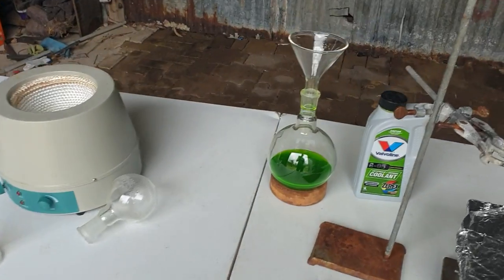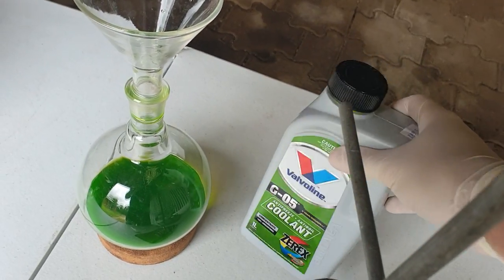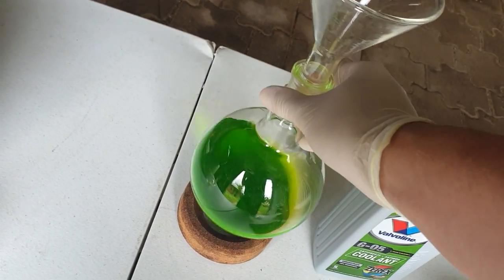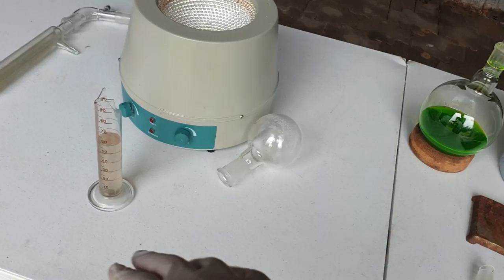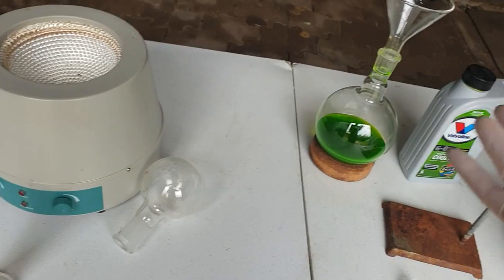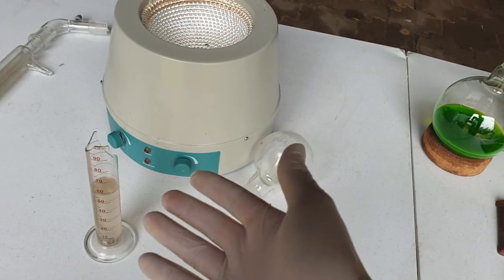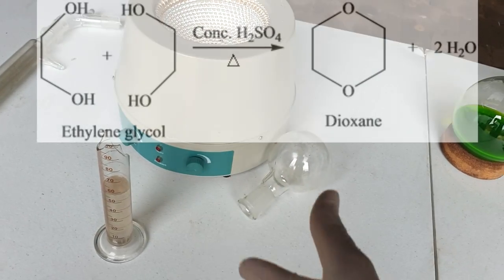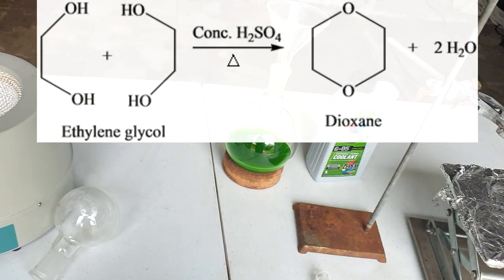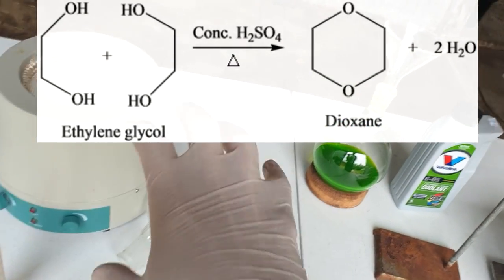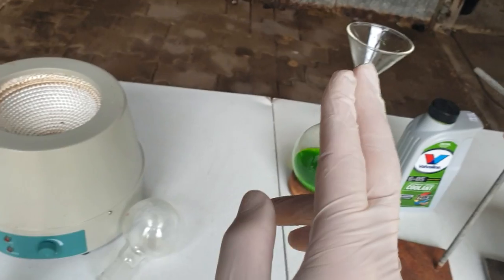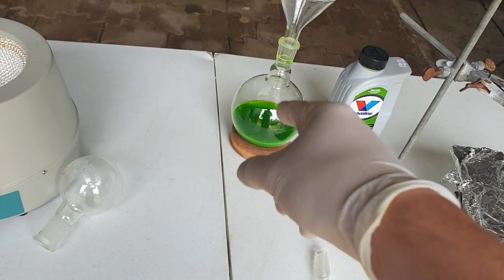Starting with the dioxane here, I've got the same antifreeze that we distilled the ethylene glycol off of, mostly ethylene glycol with a tiny bit of water and a whole lot of dye. We got like 250 to 300 mils there. I think I used 70 mils of concentrated sulfuric acid last time; we got 55 mils. I'm just going to see if it works with slightly less acid because I'm always interested in conserving my concentrated sulfuric acid. Then we're just going to set up a simple distillation, run it up until the point where it starts to tar over. We're going to try and prevent it from tarring up.